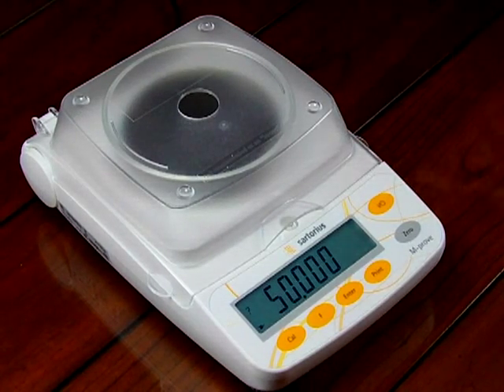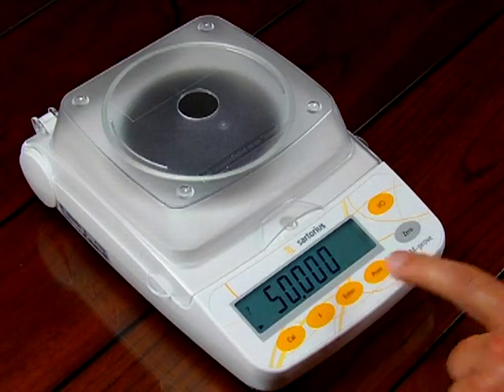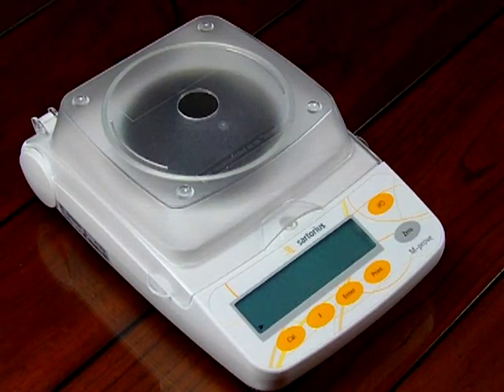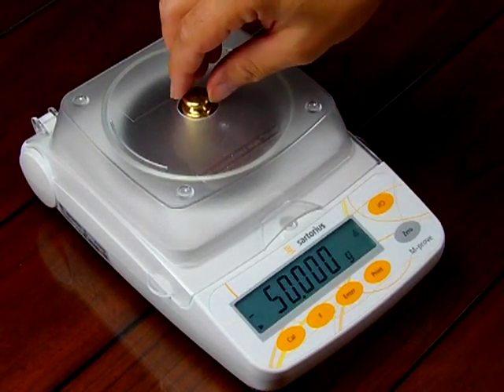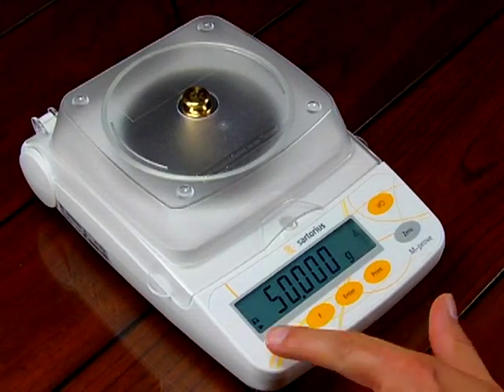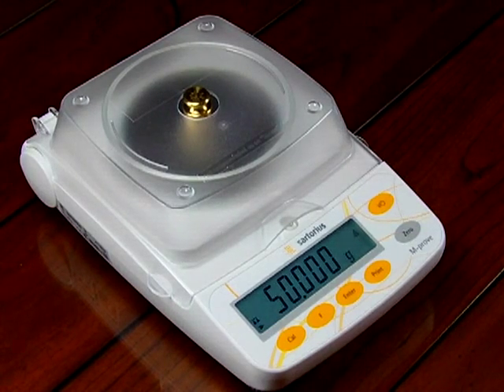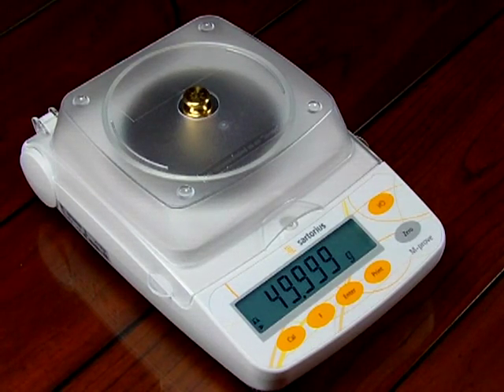I have a 50 gram weight, and it will work going through this hole at the top of this windshield. So to start the calibration, I hit enter, and it says Cal and it's flashing. I put 50 grams on the platform. And you'll notice the balance has a stability sign over here with the two weights hanging down. So we know now the balance has been calibrated — the calibration is complete.